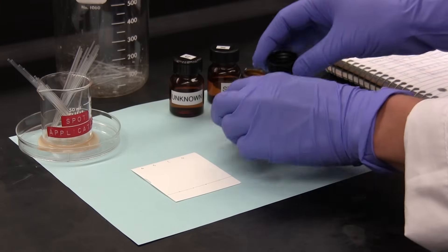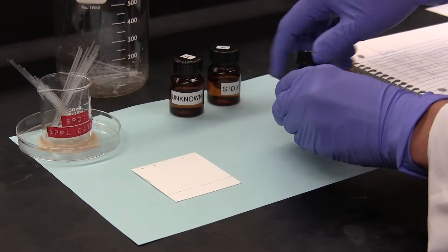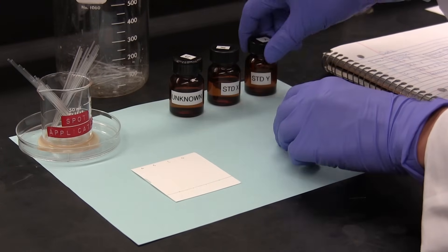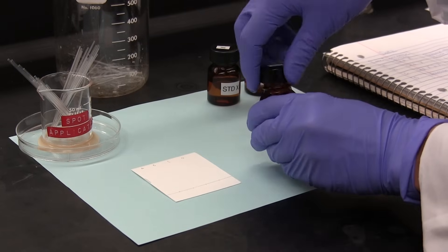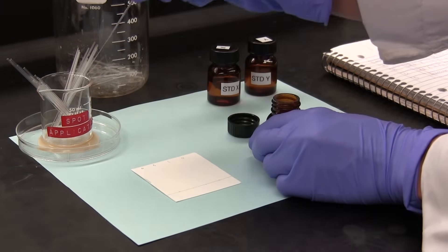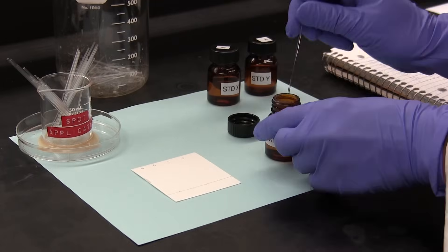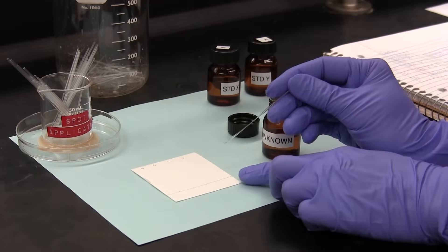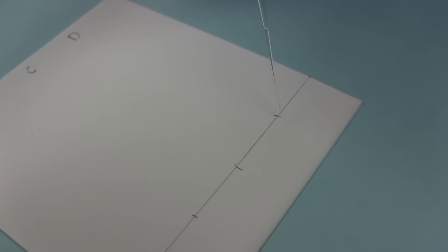Note how we use a clean capillary applicator with each solution. This is to avoid cross-contamination between the lanes. And so with a clean capillary applicator, we apply a spot of the unknown in lane D.